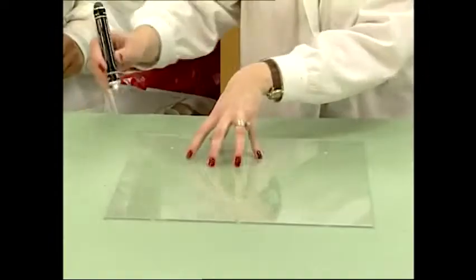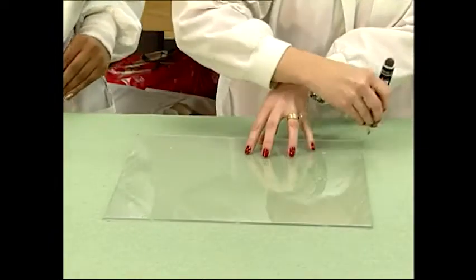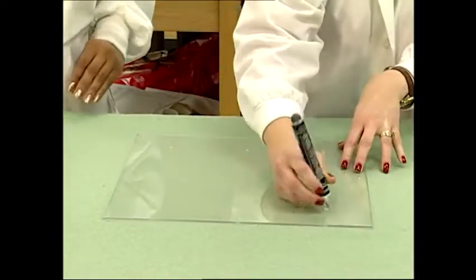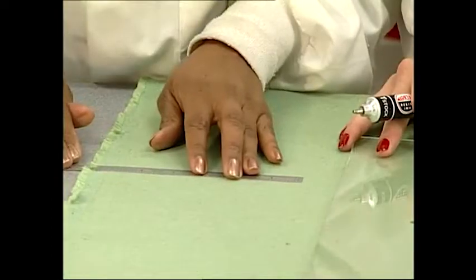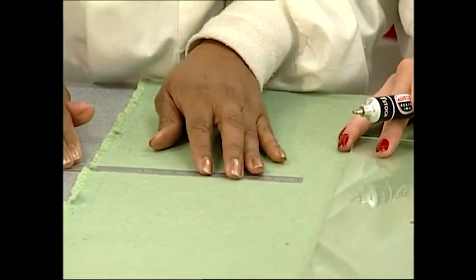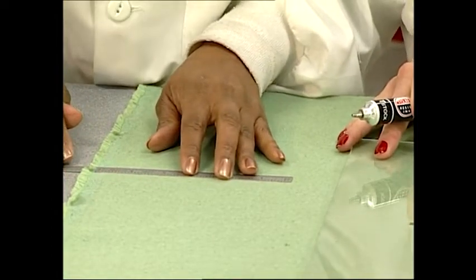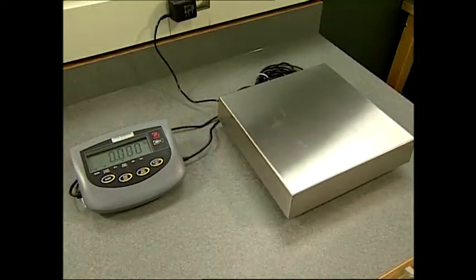Additional equipment includes ballast cloth, an indelible ink marking pen, a 15 inch by 15 inch template cutting guide, a ruler or measuring system that yields direct shrinkage numbers, and a weighing balance or scale.